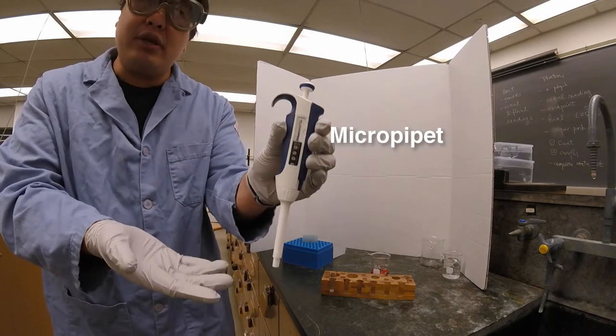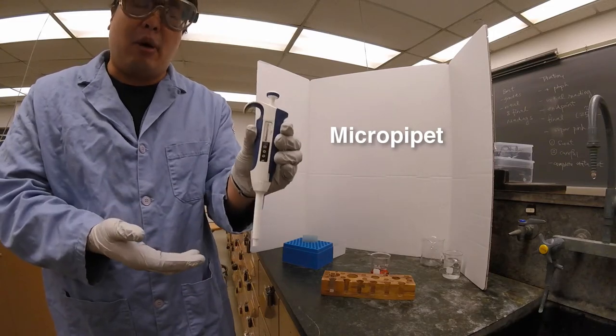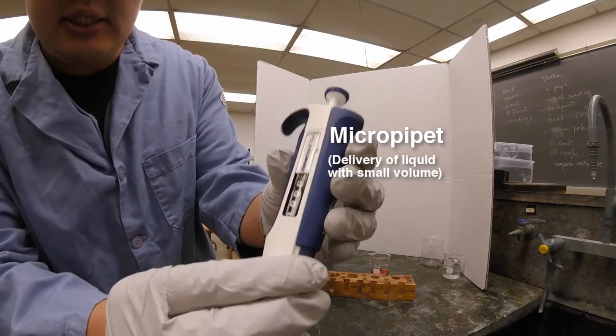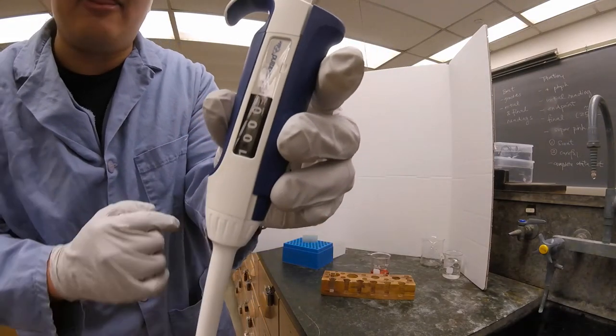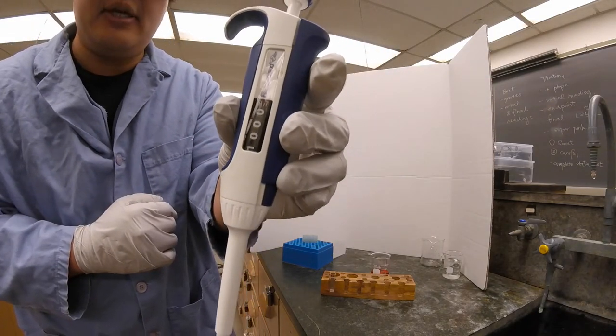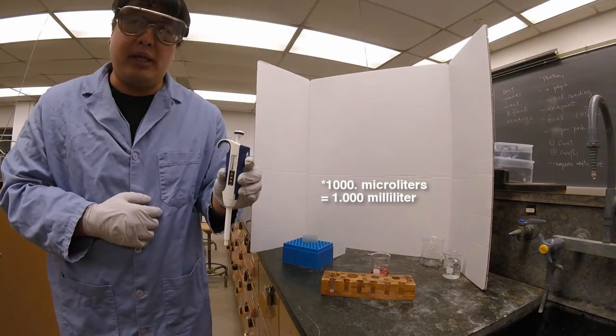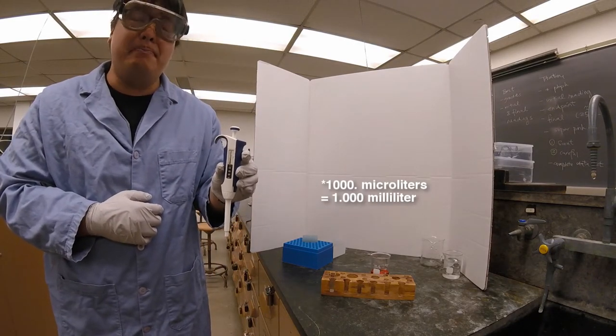However, it's really good at delivering very small volumes. If you can see right here, that is denoted as 1,000 microliters. So if you convert that, that is 1.000 milliliters.